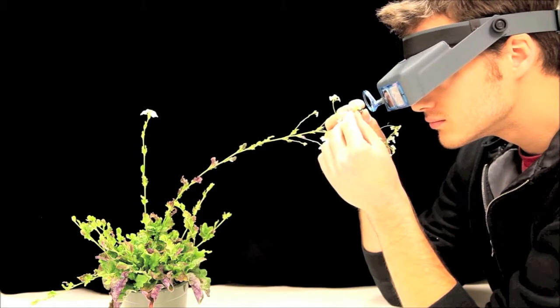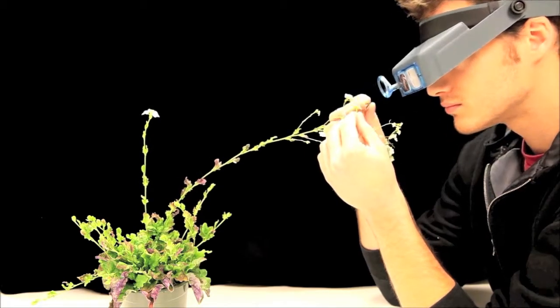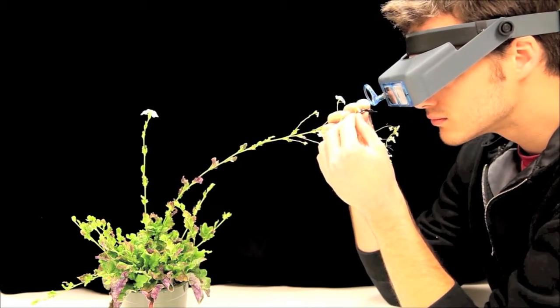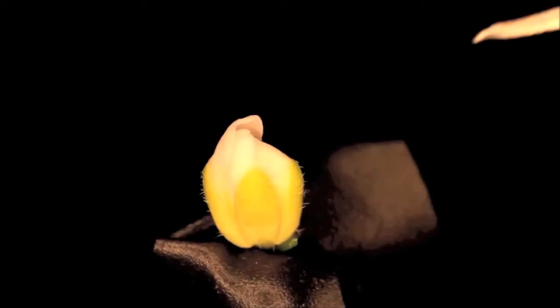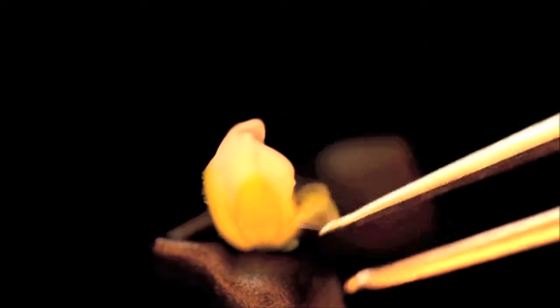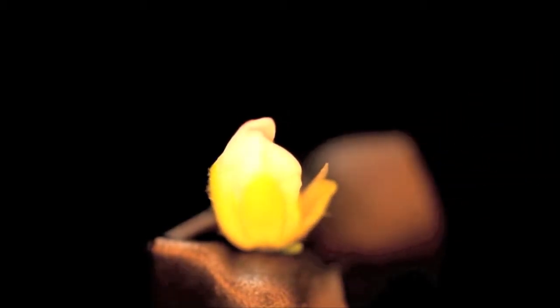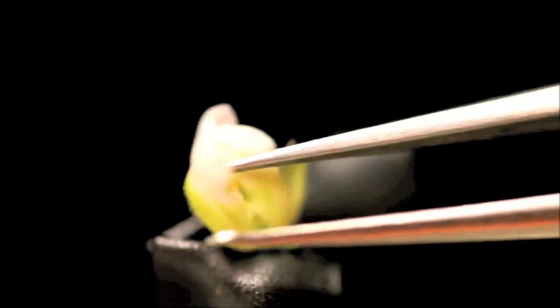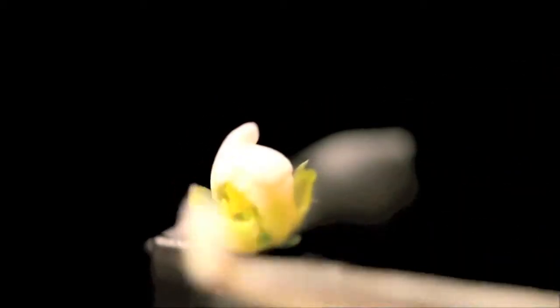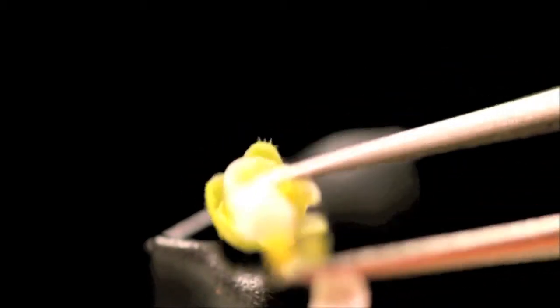Start by putting on your Optivisor and try to observe a wild type flower. Use your fingers at the base of a flower to try to steady it and keep it in focus for the next step. For the next several moments, we'll be trying to use your tweezers to slowly peel back and remove each of the sepals and petals of the flower. Your goal is to remove nearly all the petals and reveal the inner pistil and stamens.